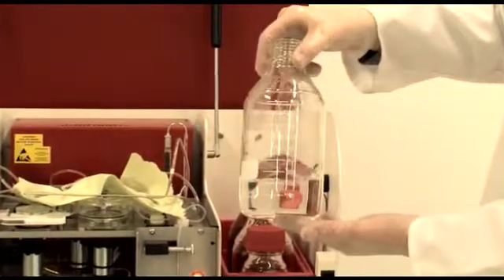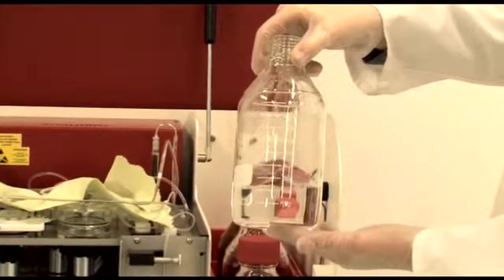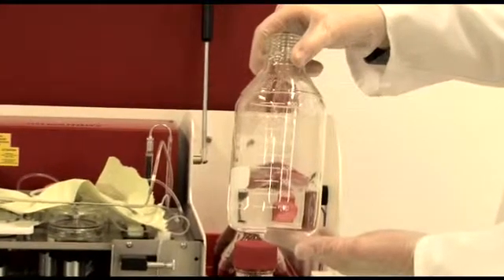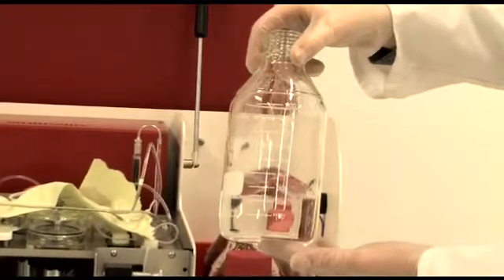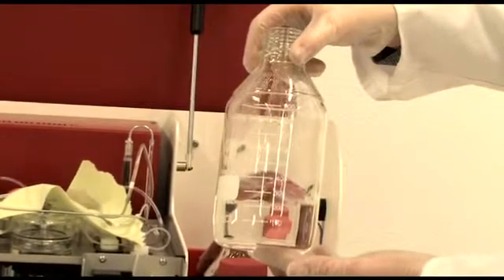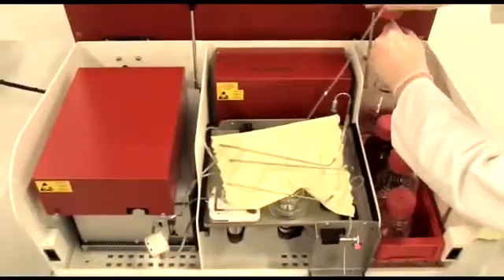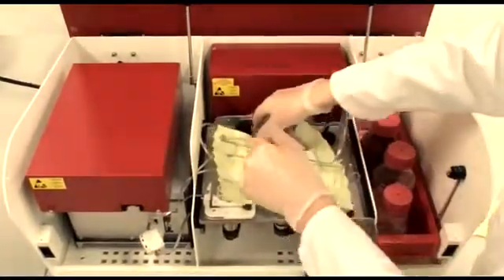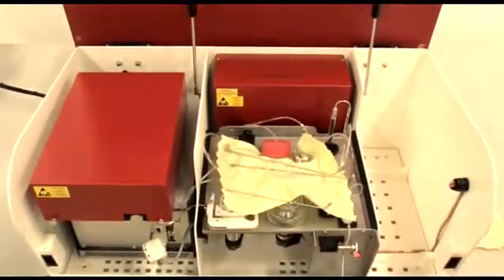The fourth bottle is also a Triton Solution, necessary for the so-called sheath flow that is inherent to the flow cytometer principle. The pipettes are labeled to avoid mixing the fluids. The concept of the instrument is based on clean and fresh liquids every day. Therefore the size of the bottles is based on the number of around 200 samples analyzed on a working day.